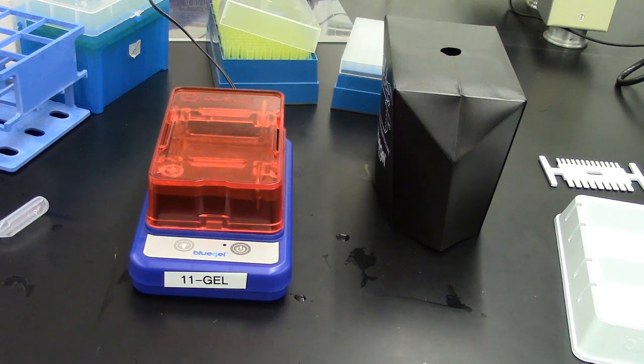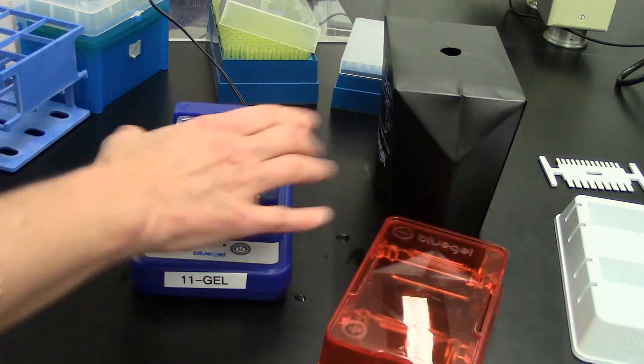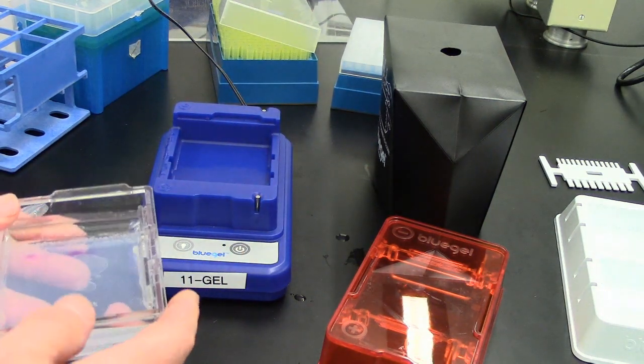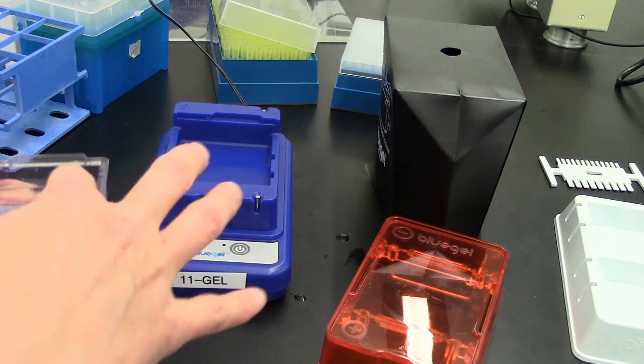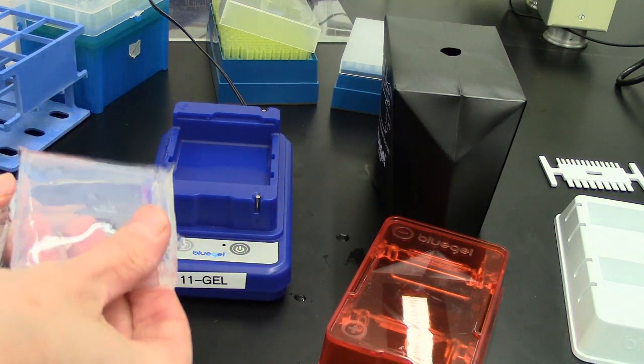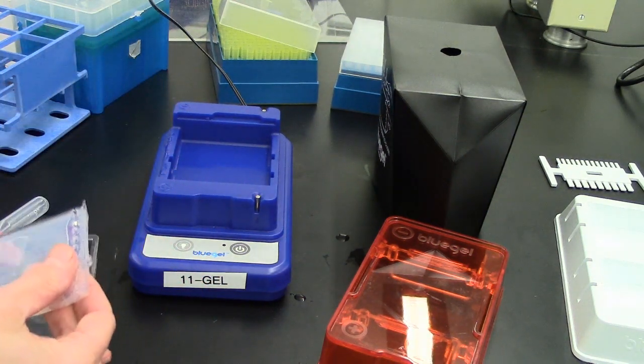After you have viewed your electrophoresis products and taken a picture of it, take the cover off the box. This internal chamber with the liquid - you would dispose of this liquid in the sink. You can take out the gel and dispose of it in the garbage can and clean off all your material.